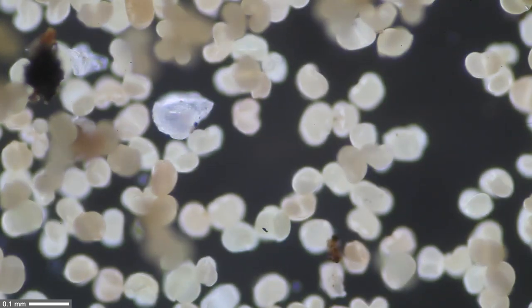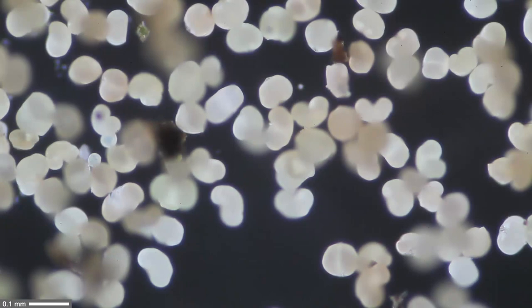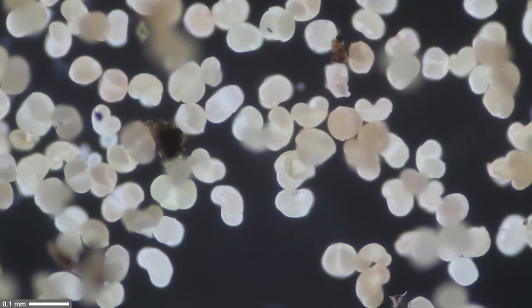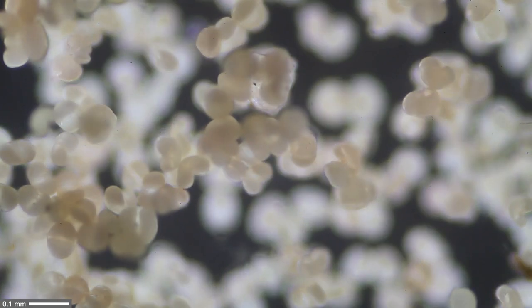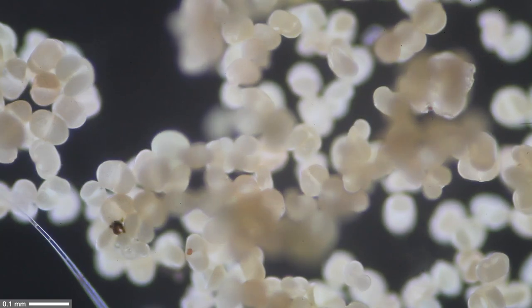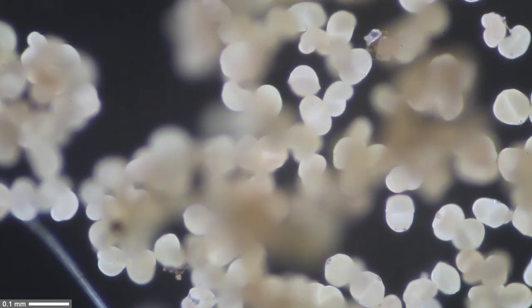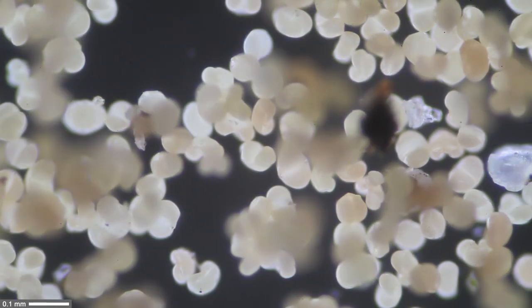The reason is because they are stacked on top of each other. This is the case because I applied a spacer ring. Without the spacer ring, the cover glass would actually push them all flat towards the slide, and that would probably make it easier to focus because then they're all in one plane level. But I just wanted to try it with a spacer ring. It gives it a slightly more natural appearance if they're also stacked on top of each other.